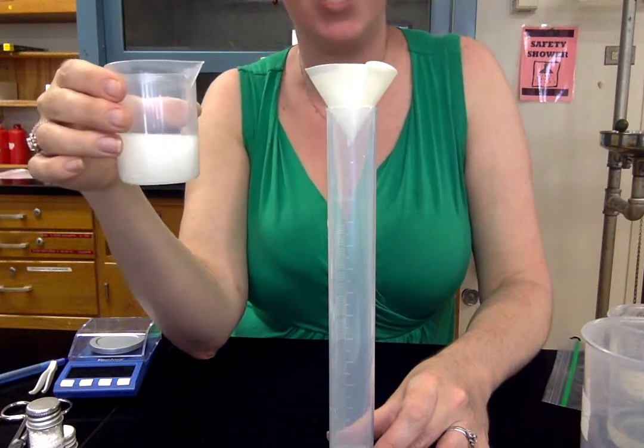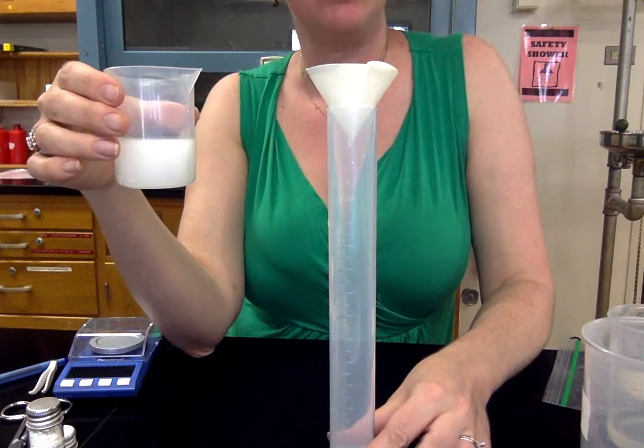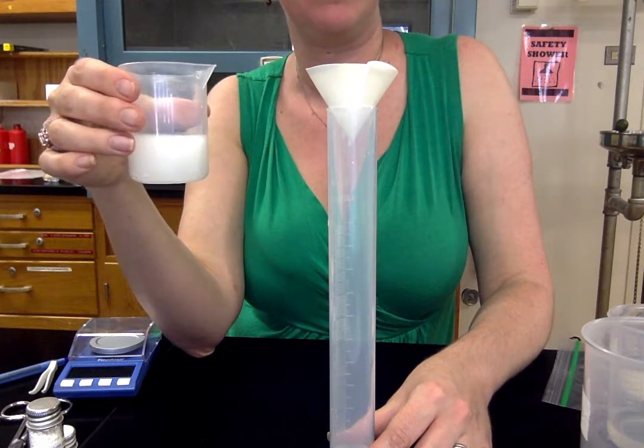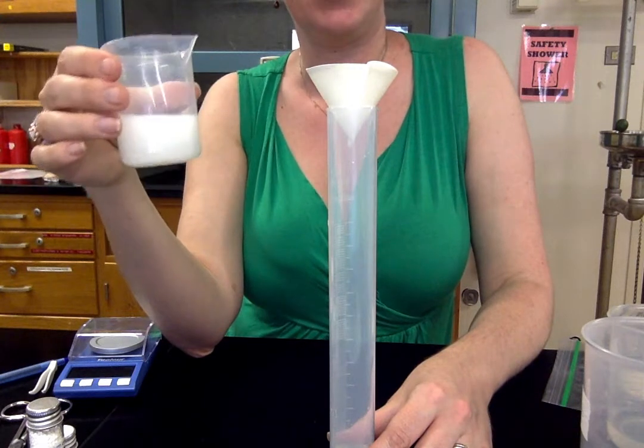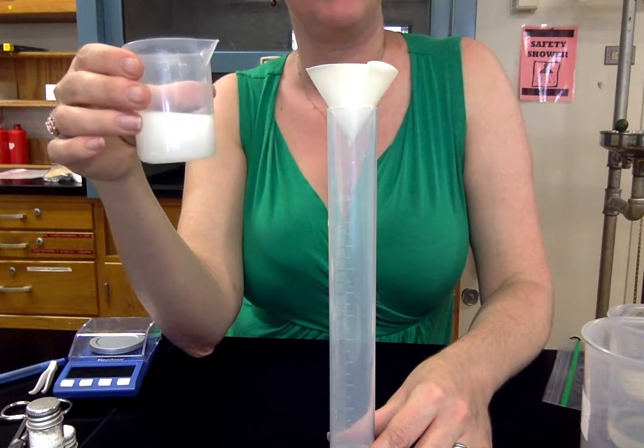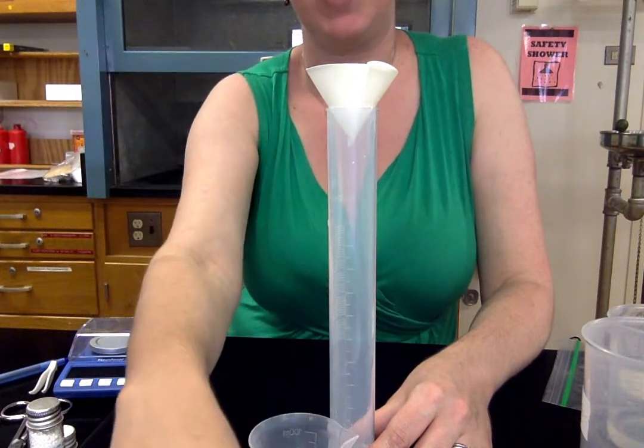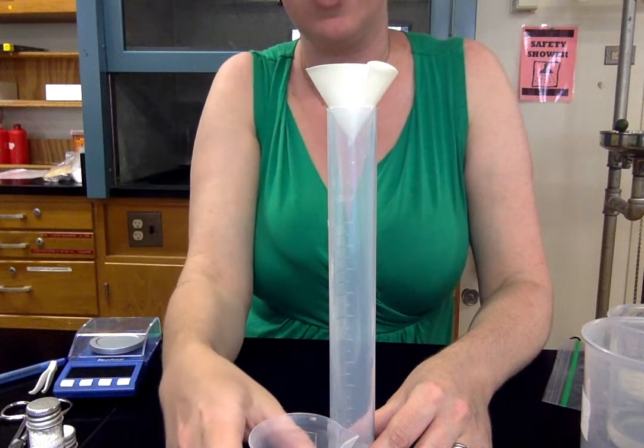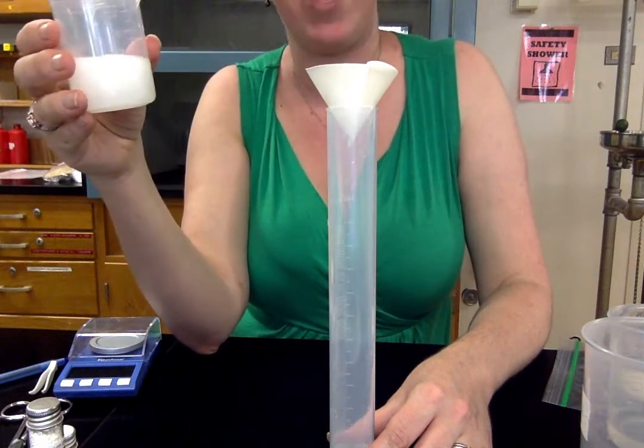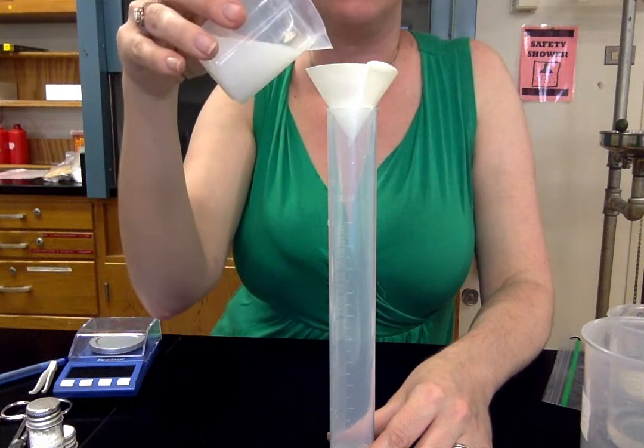And it's going to take a while to dry. In a lab setting, we might dry it over a hot plate so that we can do it in a matter of minutes. But we're going to do it in a low tech safe way at home, which is air dry. And this can take a couple of days. Filter paper is very absorbent. So it's very wet. As you can see, it's full of water. We need it to dry out because we're ultimately going to need to weigh the product.